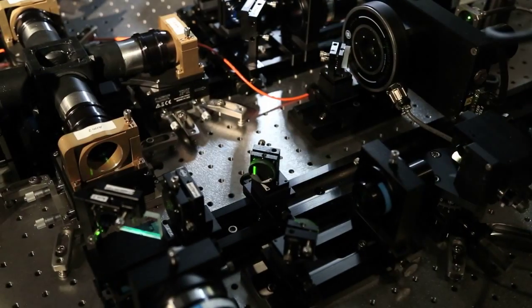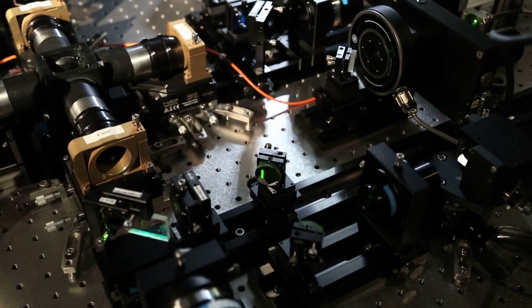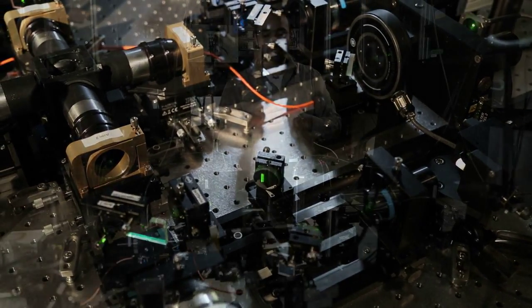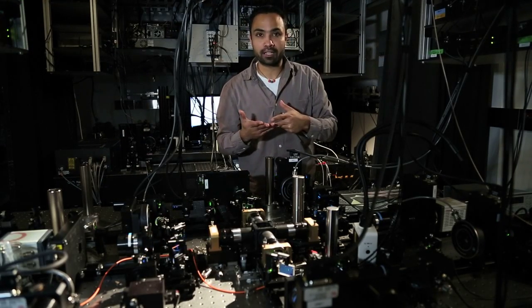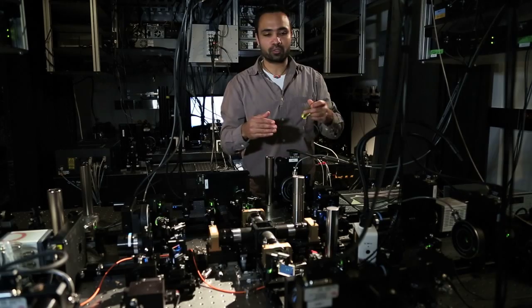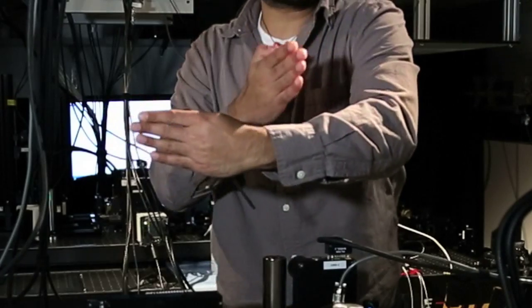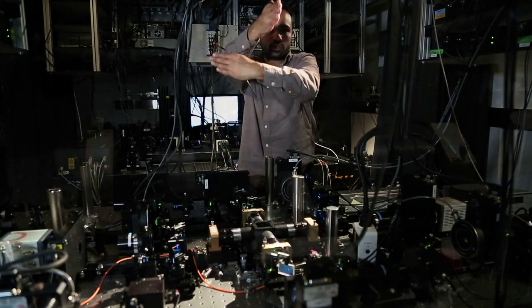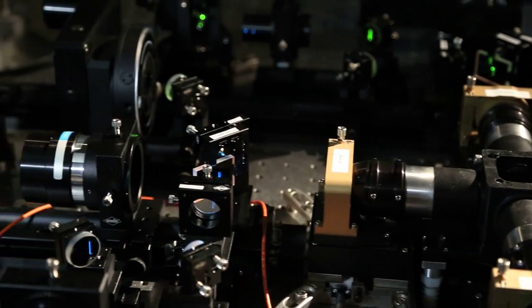So you can take this analogy of a four-way stop sign, where you have stop signs in all four directions and traffic flowing in sequential turns. But you really don't need to do that if you have an overhead bridge where orthogonal traffics can flow at the same time. So this is the same thing we do here. So we have photons coming in here. Instead of intersecting with those photons, we send in photons slightly offset in the spatial direction, and now we do the scan. And this way, there's no crosstalk between any of the views.